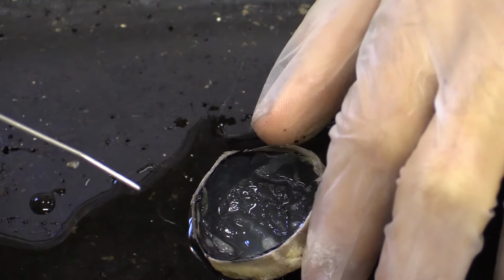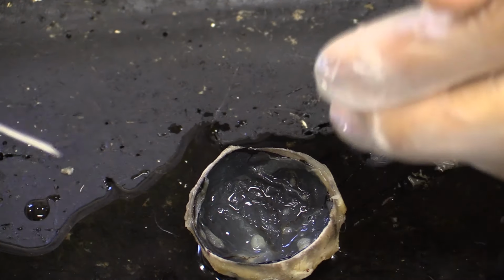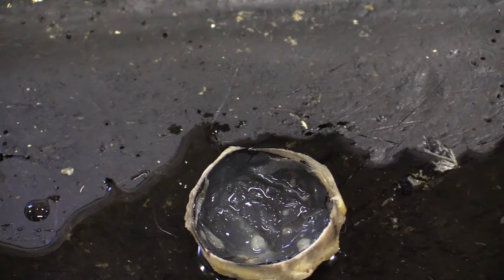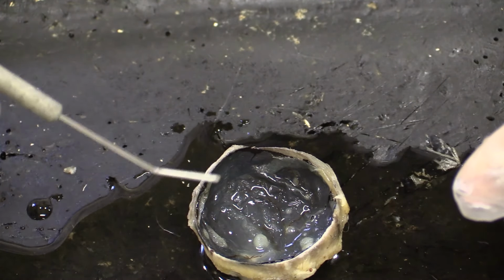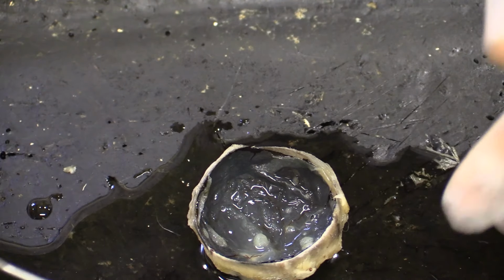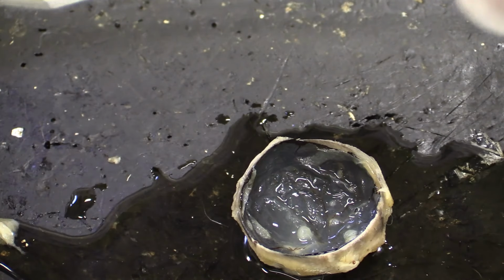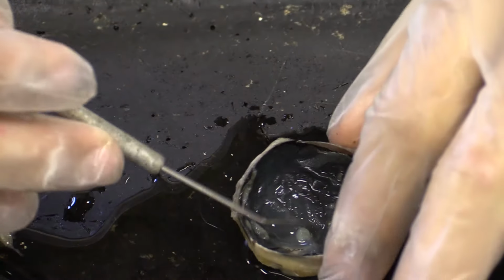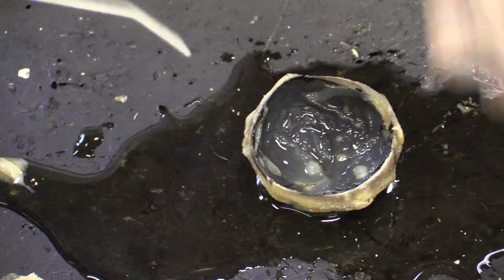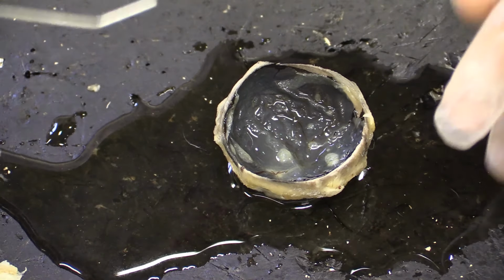And a little fun fact is that animals which are nocturnal or crepuscular, animals which feed at twilight or dusk, actually have a metallic and iridescent layer just underneath the retina, which reflects the light twice. That's why sometimes when you shine lights into the eyes of cats at night, it's all shiny. It reflects back as shiny, because they actually have a bit of metallic shine in their eyes. So they can have better night vision than us humans, and in this case, sheep.